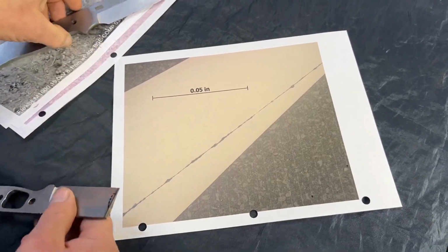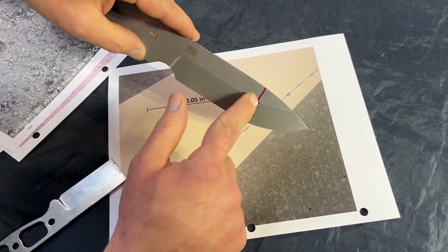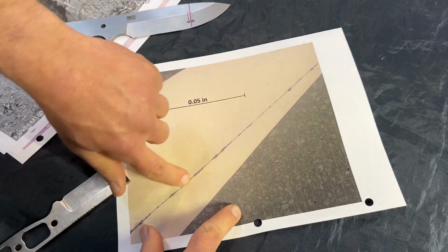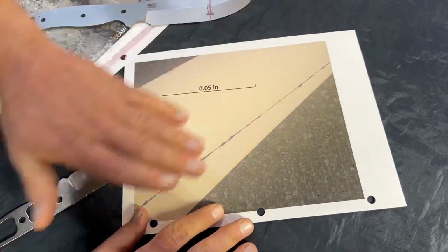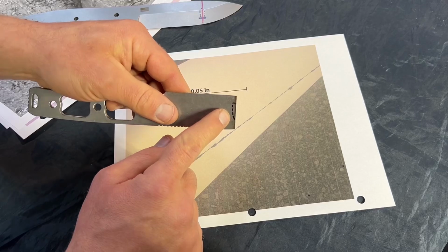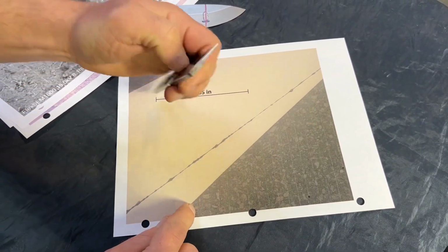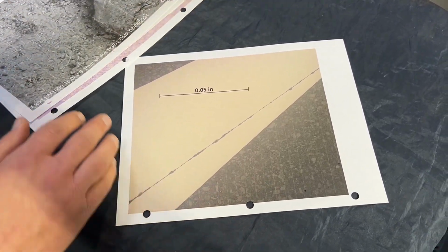When you're looking at this from the top, it's kind of an irregular football shape. But then as you get at it from the side, you can see that it's just one thin pocket of whatever that is. I believe it just got sandwiched out and kind of rolled in there like when you're rolling out dough baking. So whatever that is, that's a better look at what that is from the side, just looking at it from the interior of the part. So I hope that clears up any questions about the images we're looking at so far.